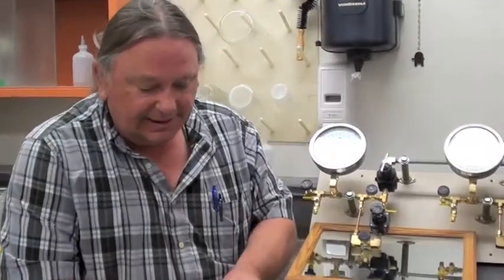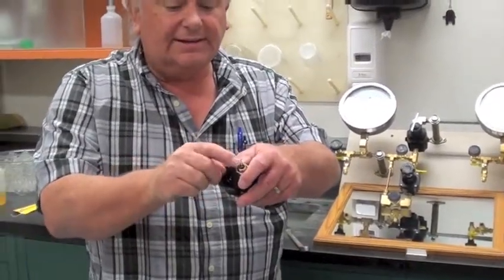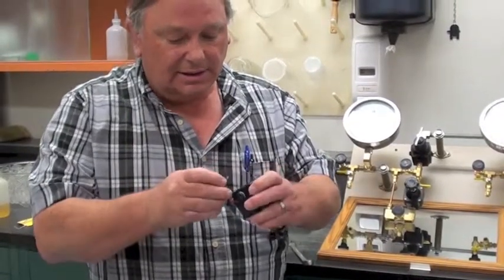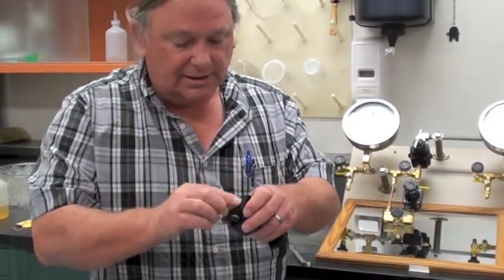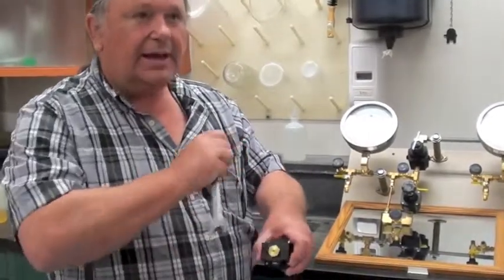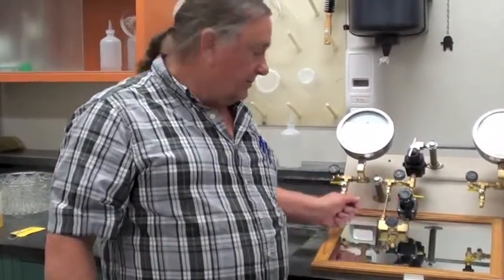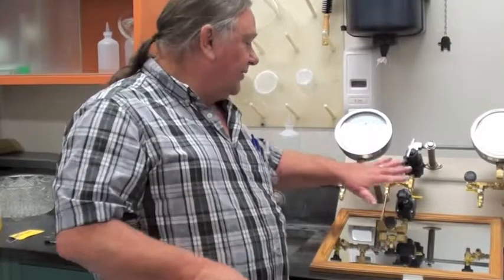Once the seat's back in place, check these parts here, make sure that this isn't bent or cracked. Reassemble it, retighten it, and it should be okay now. When it's mounted on the manifold, you may need a mirror to hold back here to watch while pulling it out. Make sure there's no pressure whenever you do something like this.